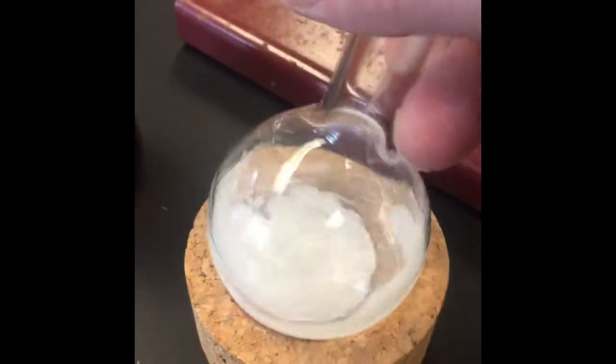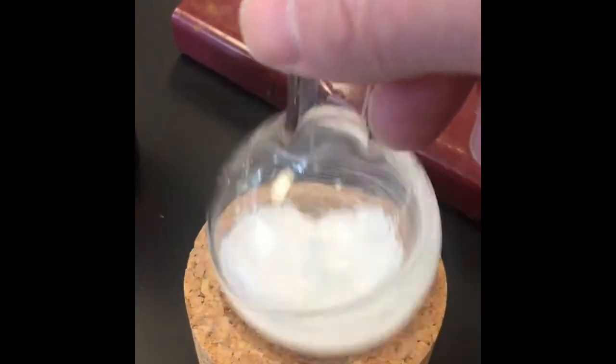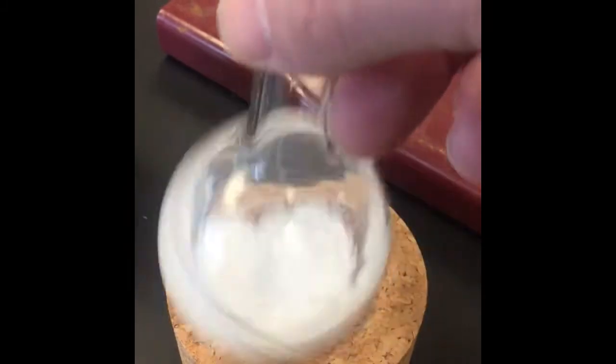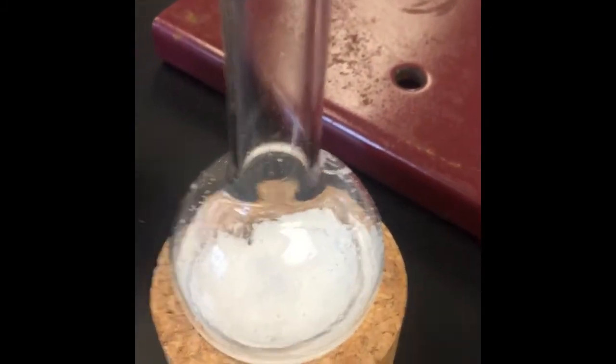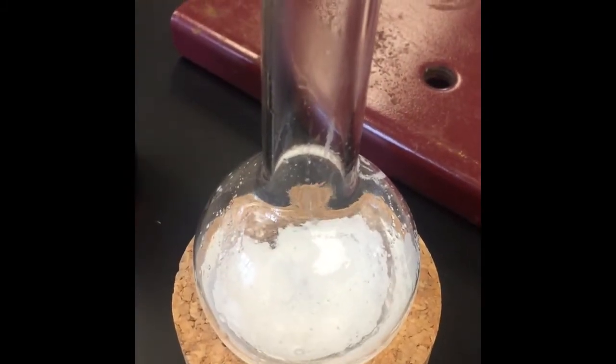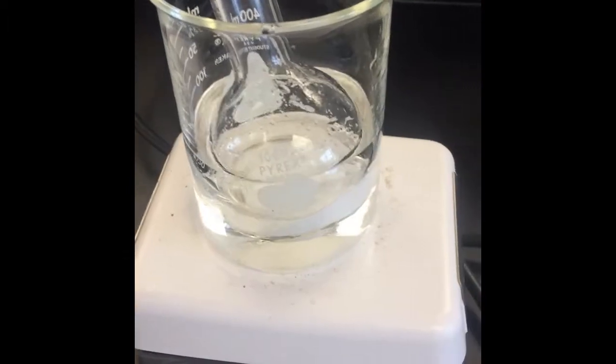That solid is not actually the product we're looking for, so we're going to have to heat this up for a while in a hot water bath. So now we're going to heat this on the hot water bath.